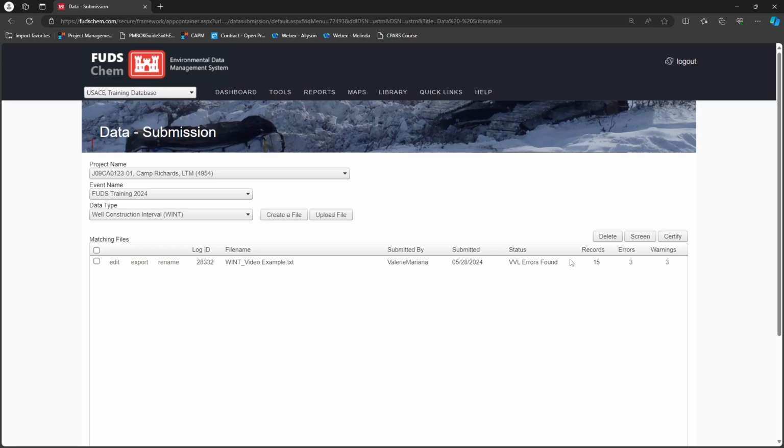For chemistry SED files, these checks compare the file to the eQAPP and the field data entered by the contractor to confirm everything matches. This helps ensure that the client is getting the data they need, which can save costly rework by catching discrepancies early on. Since checks are performed in waves, it's possible to resolve all errors from the first wave and then encounter more during the second.